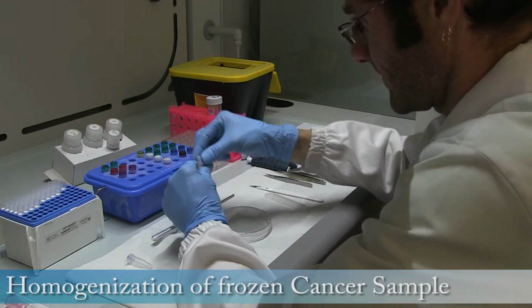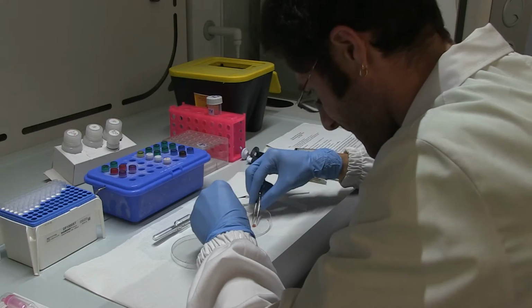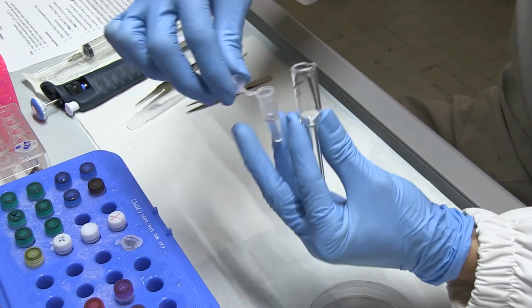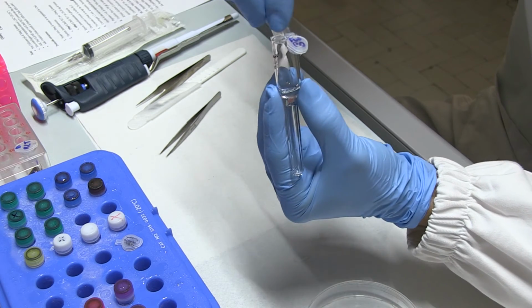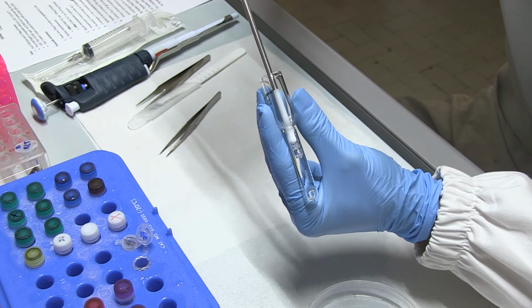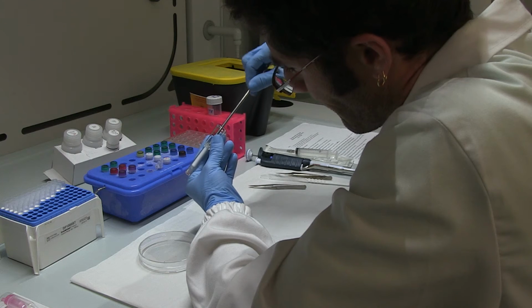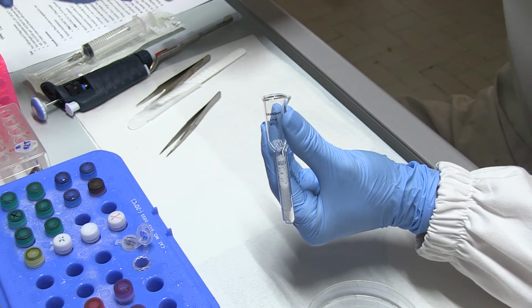Now, let's see the RNA extraction. Biological samples are first homogenized in the presence of a highly denaturing guanidine thiocyanate-containing buffer, which immediately inactivates RNases to ensure purification of intact RNA. In addition, the lysate is passed through a 21-gauge needle attached to a sterile plastic syringe at least 10 times.